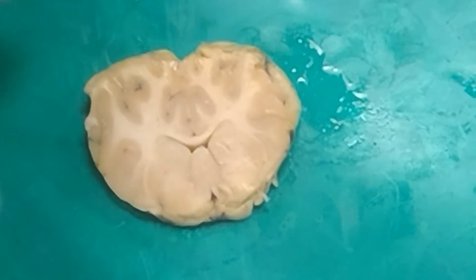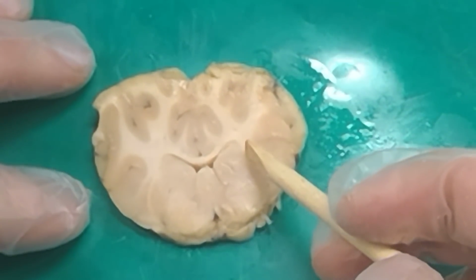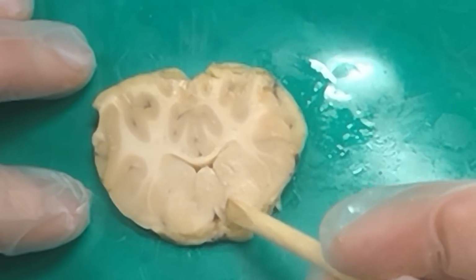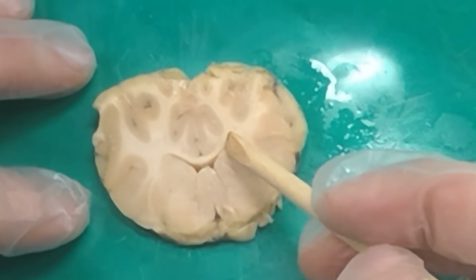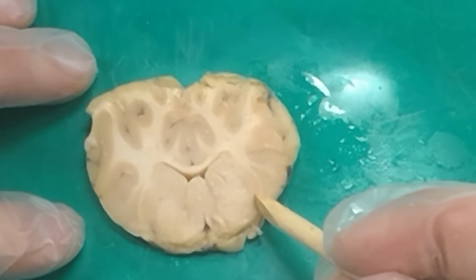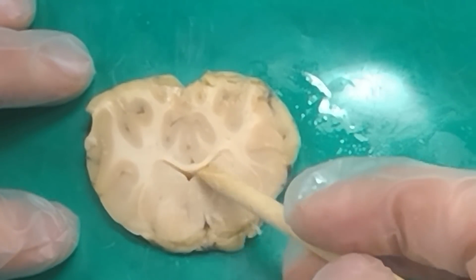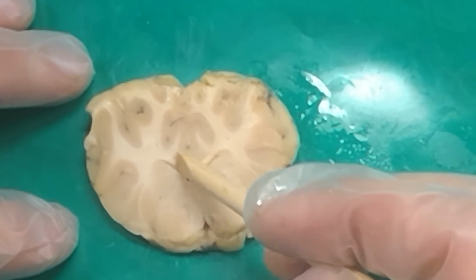If we turn this over now, we're on the other side. We can see that the white fibers now of this internal capsule kind of go down and they split out right here. This nucleus right here. Globus pallidus. And this guy now up here. Caudate. And so then this guy, which is a half moon shape over here. Putamen. This ventricle right here. Lateral ventricle. And what's the fibers above it?